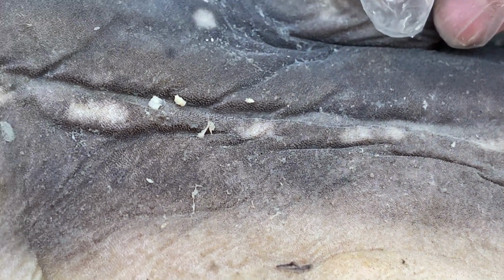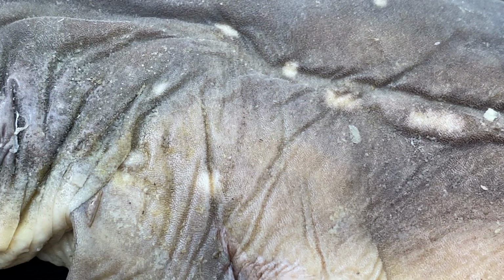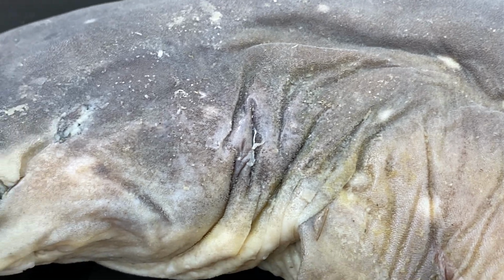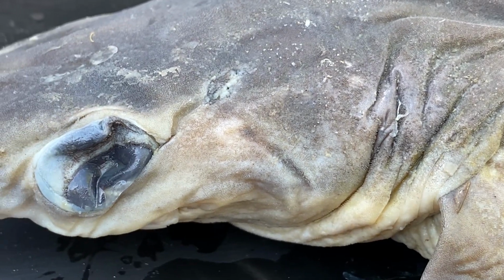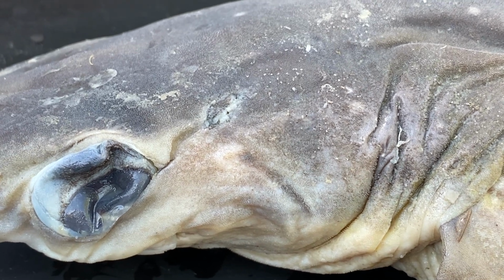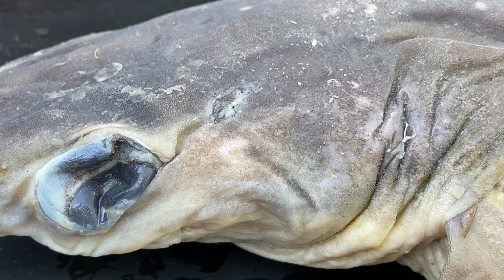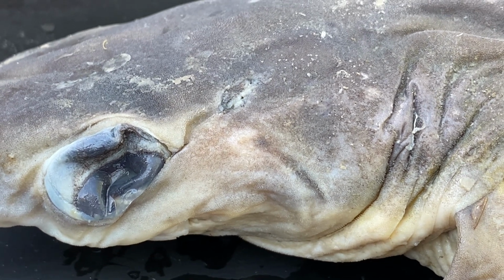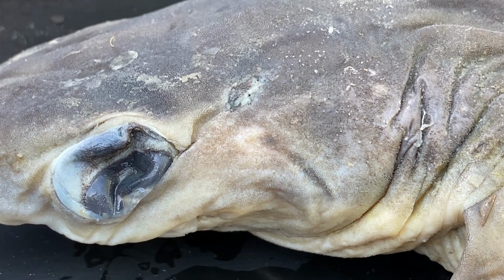These placoid scales or dermal denticles are going to have yet another way to make the shark a little more efficient swimming through the water. They'll actually trap a very thin layer of water around the body of the shark. So when you have water slipping through water, it very drastically decreases the friction that the shark has through the water. Sharks are absolutely amazing. They are perfectly built to become as energy efficient as possible because they are migrating long distances that we're learning about. So why not be energy efficient?